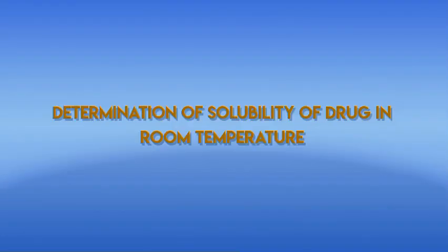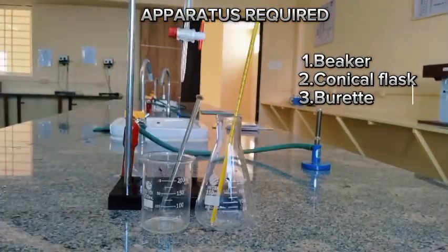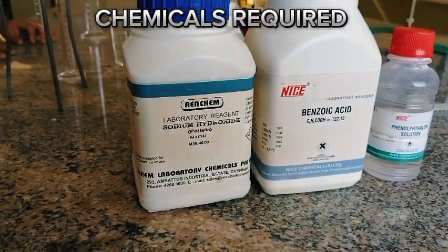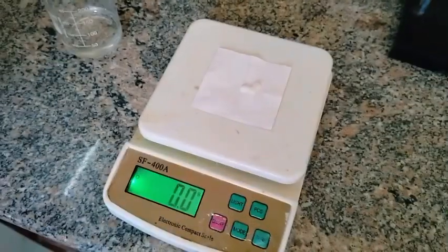Determination of solubility of drug in room temperature. Apparatus required: beaker, conical flask, burette, stirrer, thermometer. Chemicals required: benzoic acid, sodium hydroxide, phenolphthalein.